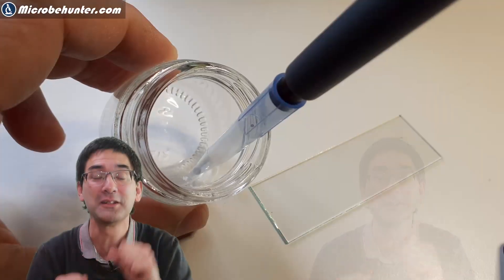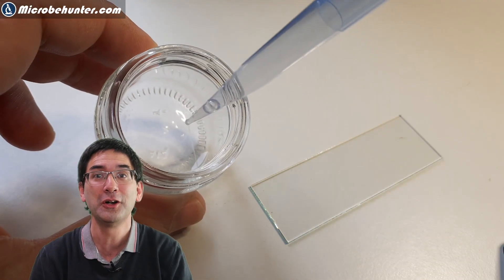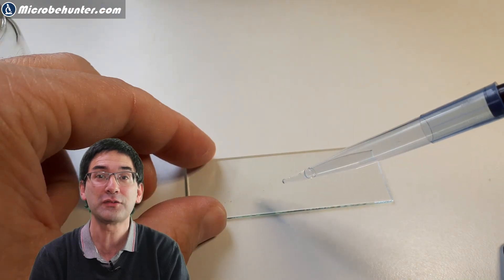Now, how do you get that? Well, I simply coughed it up. Quite straightforward — a little bit of coughing, and then I spit it into this little glass jar and then I put it directly under the microscope.